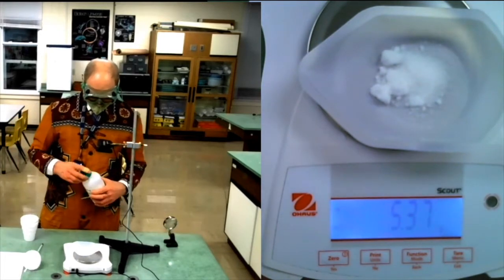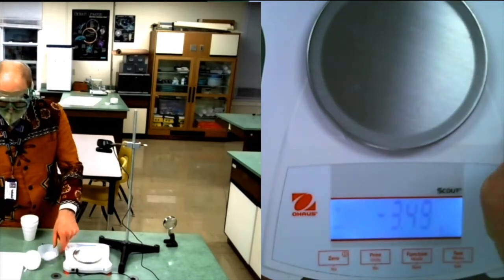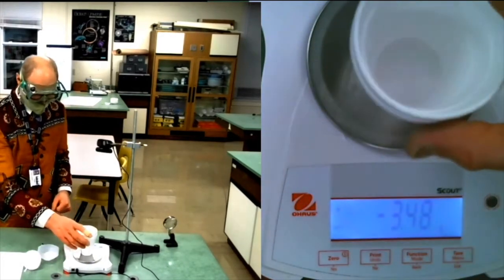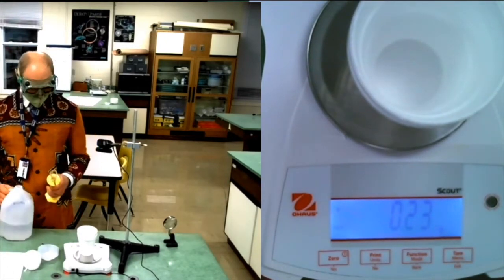5.37 grams of ammonium chloride. Now let's measure out some water and find its temperature, as usual.